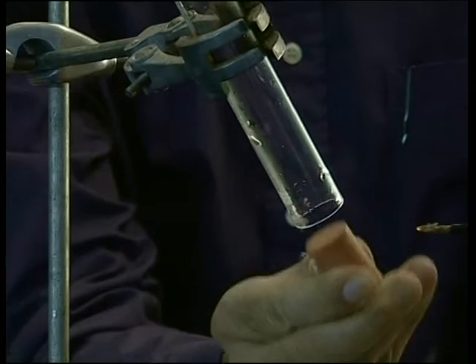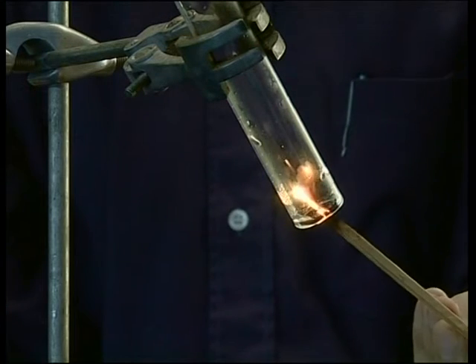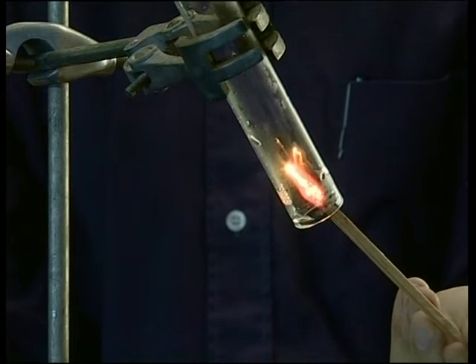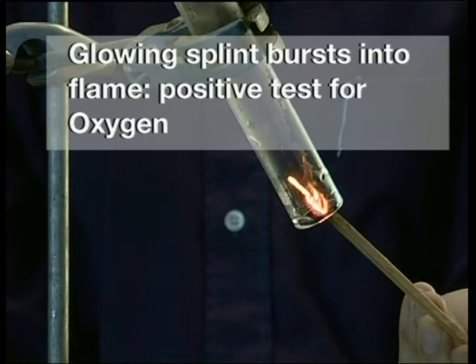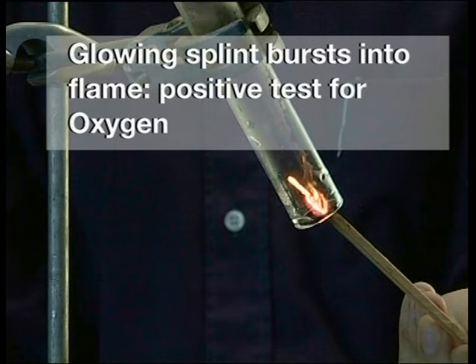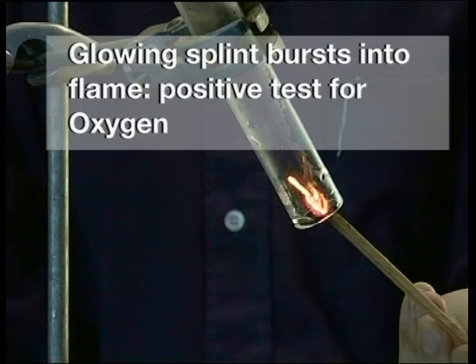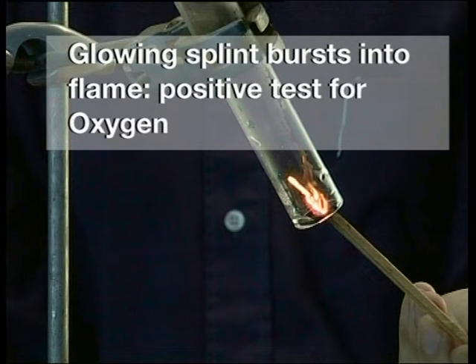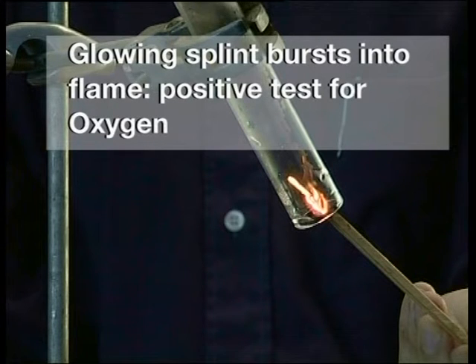Next, we look at the demonstration for the test for oxygen. Placing a glowing splint into a gas suspected of being oxygen tests for the presence of oxygen. The splint will burst into flame. This is a positive test to confirm the presence of oxygen.